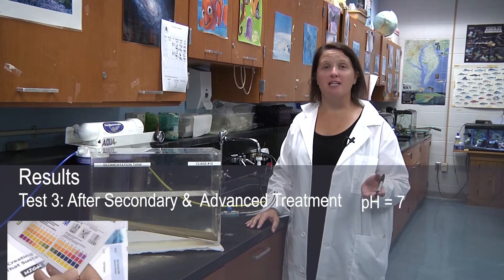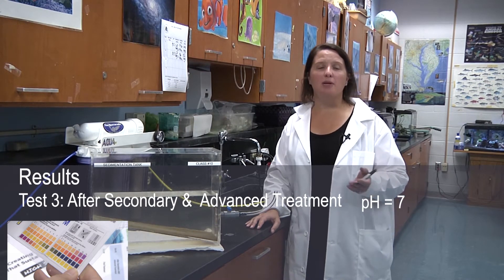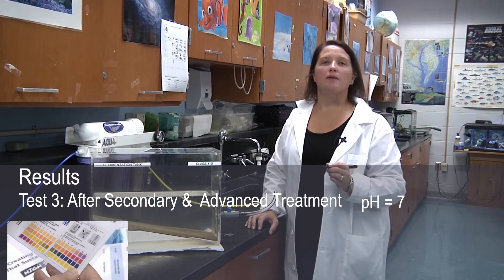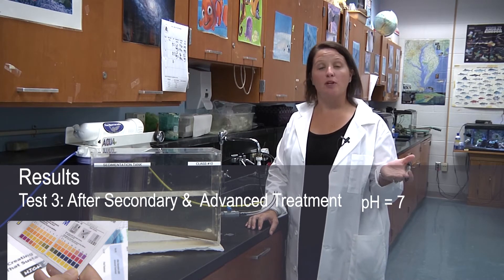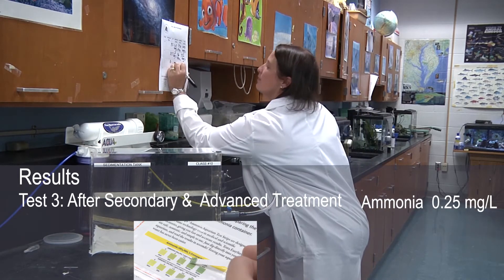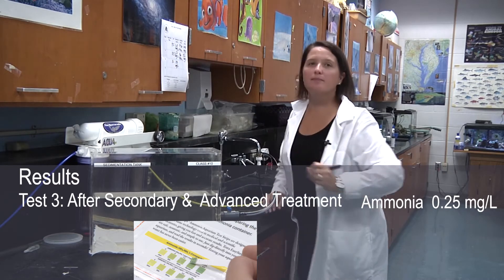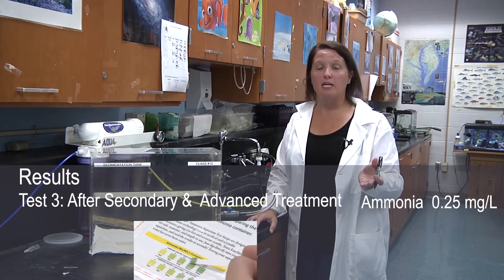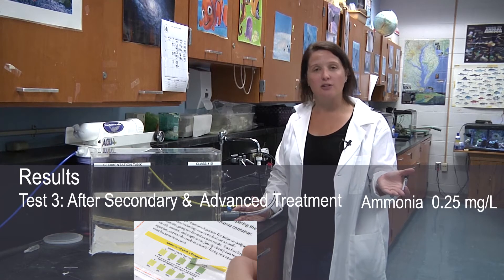Let's look at our test results for test number three, after secondary and advanced treatment. You can see that the pH decreased to seven. Aluminum sulfate may cause a slight decrease in pH, and additionally, we removed the ammonia, which is also basic. Ammonia is now 0.25 milligrams per liter — this is a big decrease and one of the largest impacts of secondary treatment. This is where the microorganisms did their jobs by removing the ammonia and converting it to nitrogen gas.